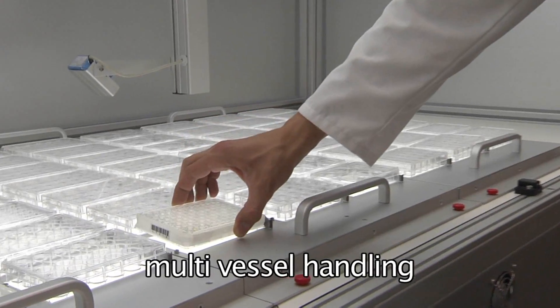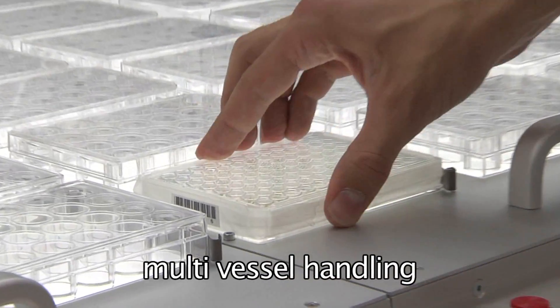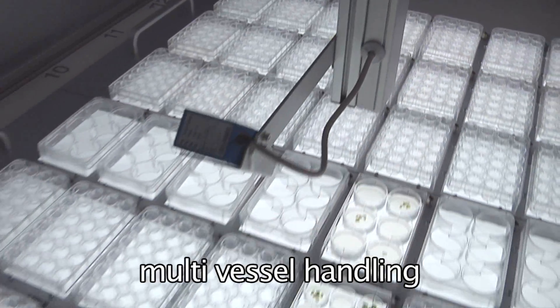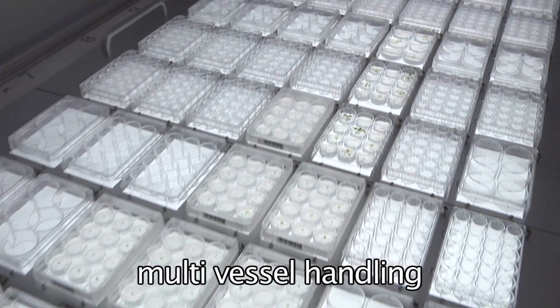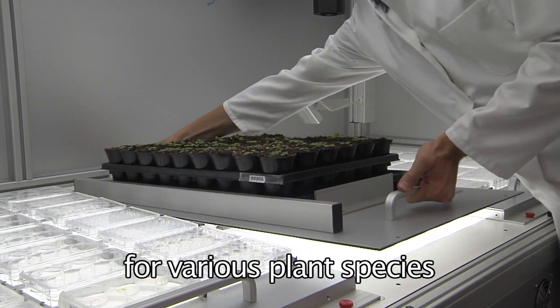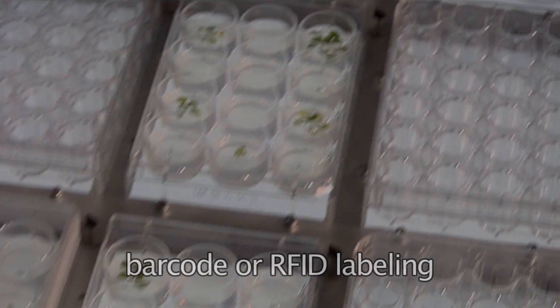Arrays of up to 30 microtiter plates are organized in trays for easy exchange and transportation. The flexibility of the Lemnatec Scanalyzer HTS system enables the matching of requirements for various groups of researchers and biological test systems.